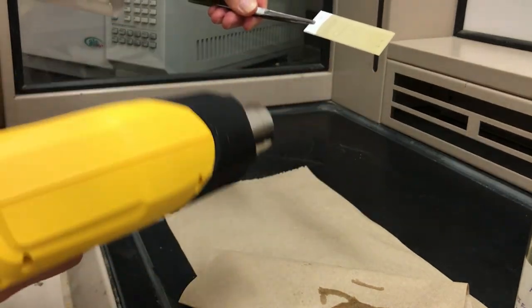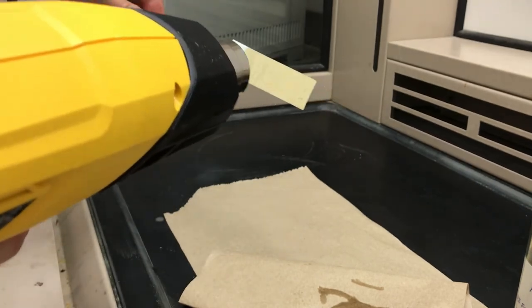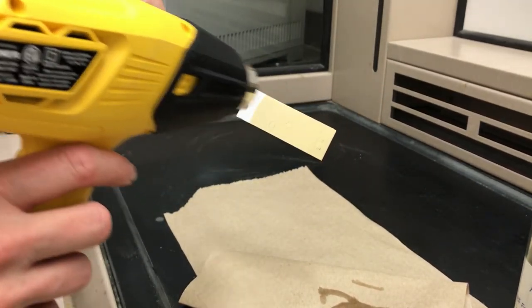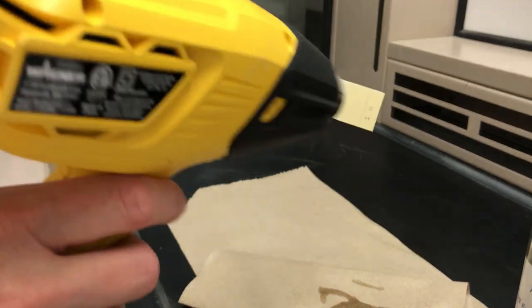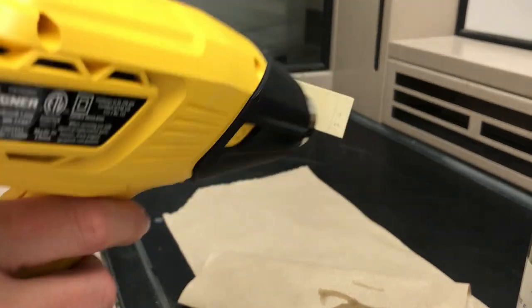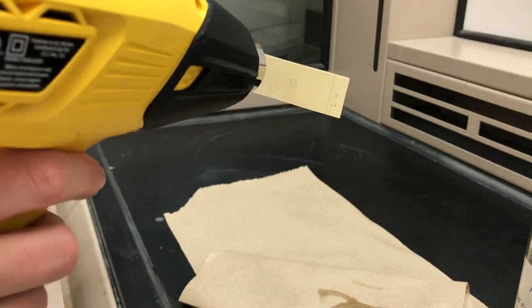In order to get the spots to show, often you have to heat it to get a reaction to occur. Sometimes people will use a hot plate, but if you have a heat gun this is a really easy way to get these spots to show up. So just wave the front of the plate with the heat gun a little bit at a time and eventually those spots will start showing up.